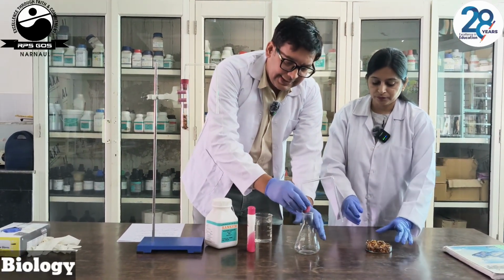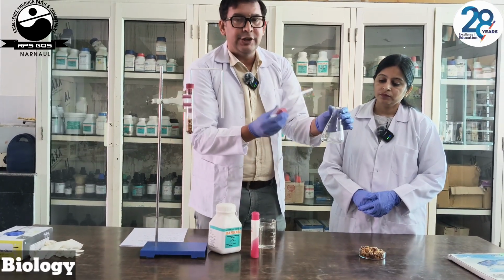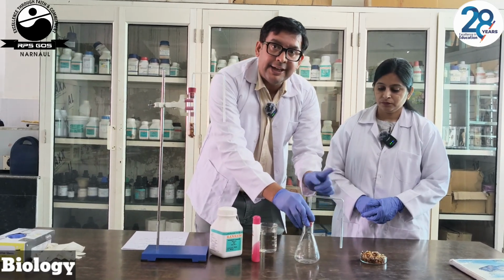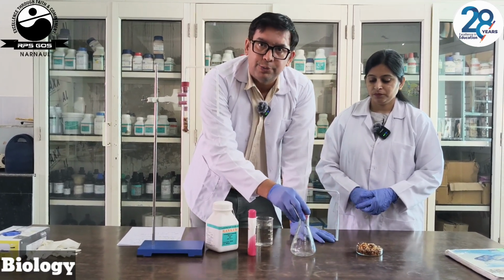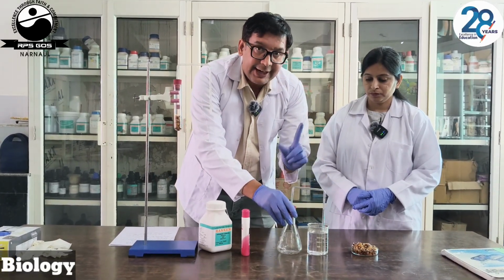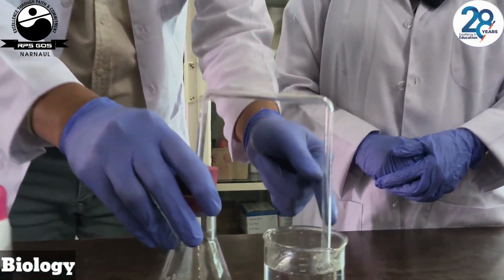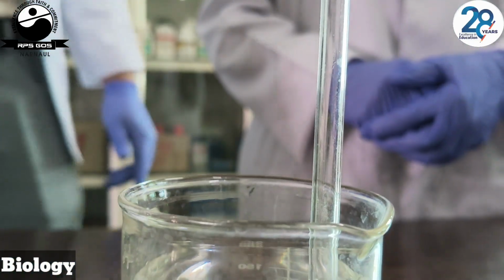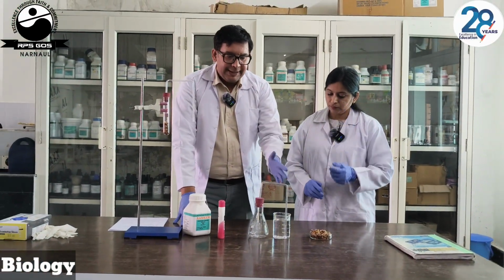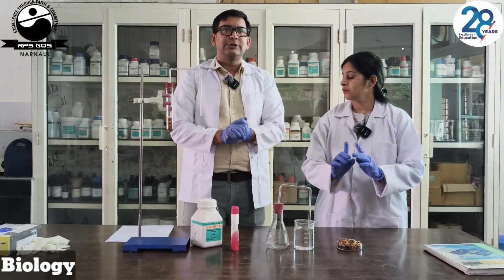When we keep these seeds in this flask, another important aspect is that we have a KOH pellet. That KOH pellet is going to absorb the CO2, and this will create a vacuum over the bent tube. When the vacuum is created in the tube, to fill up that vacuum gap, the water level will slowly rise up. We will show it in the next experimental part. Here is the material required for our experiment. So now we are going to start the experiment.